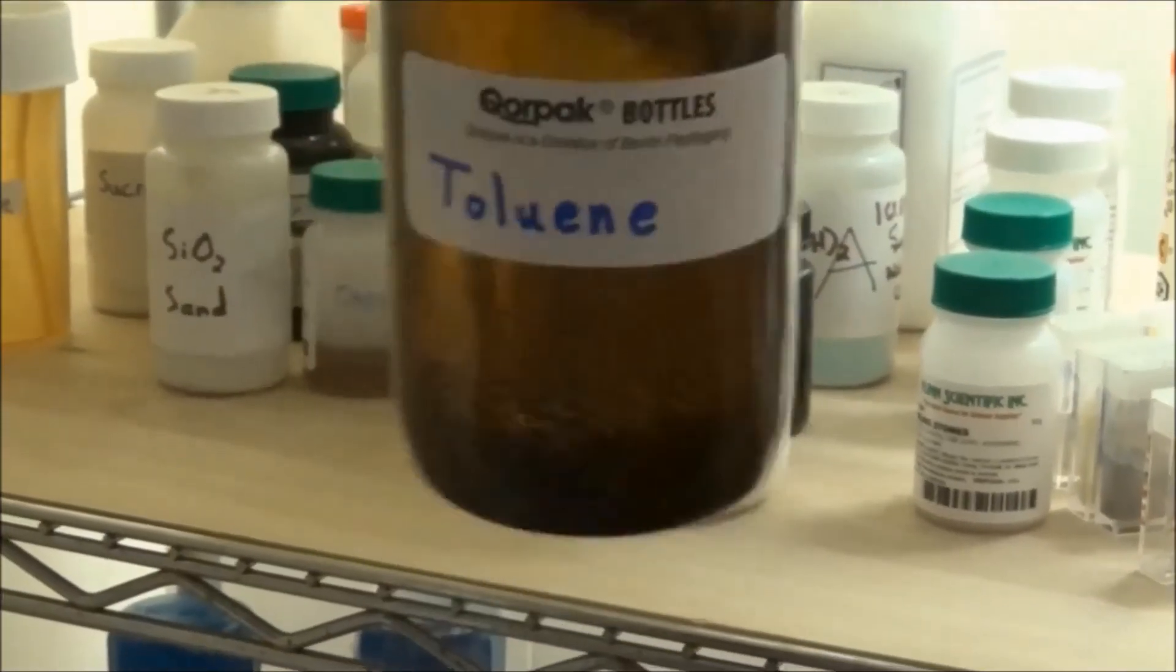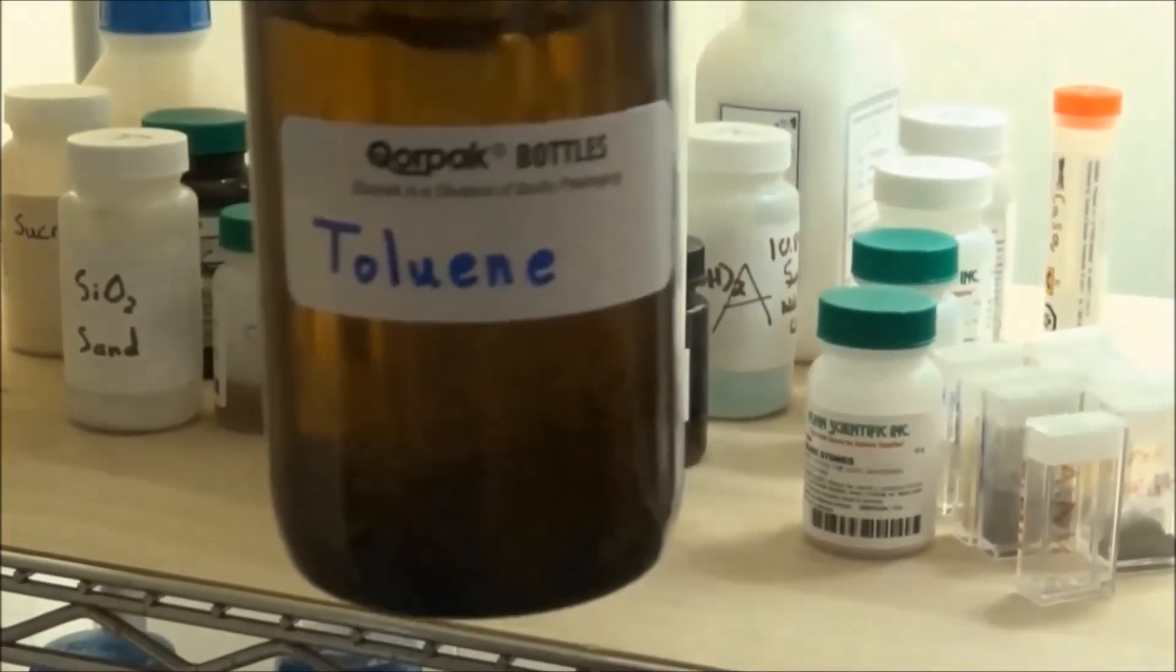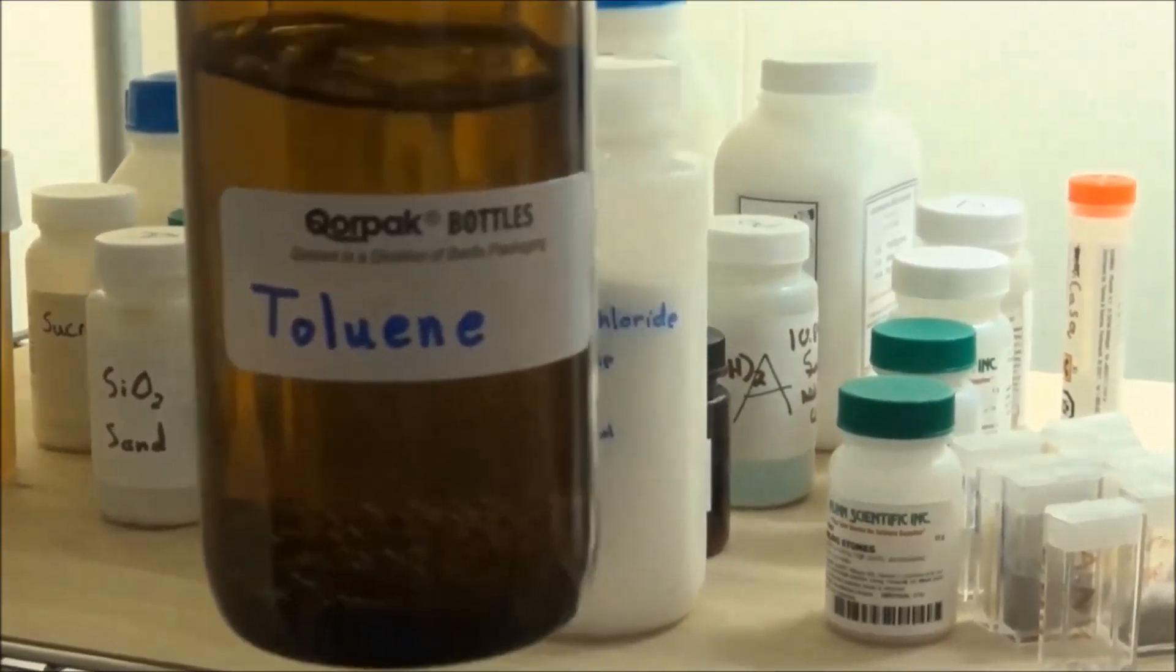Molecular sieves were added to give a bottle of dry, thiophene-free toluene, ready for lab use.